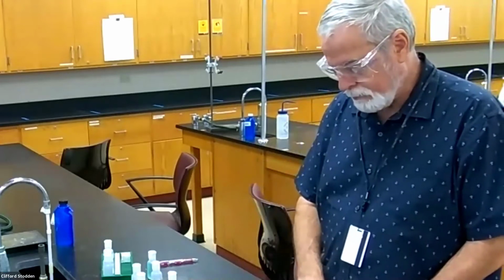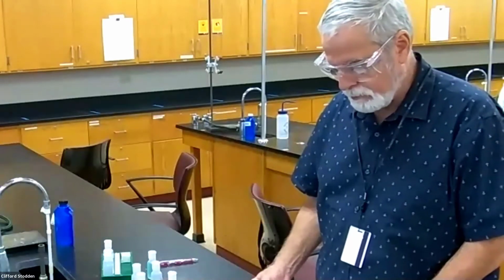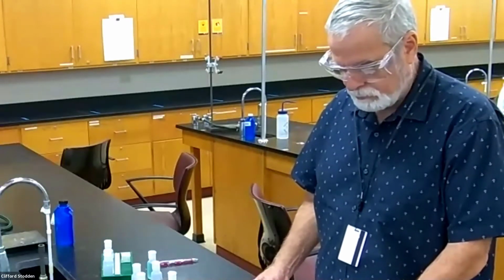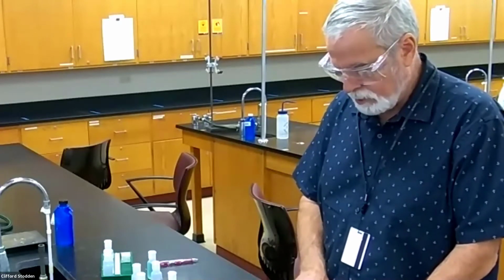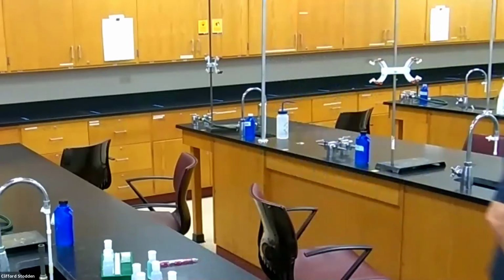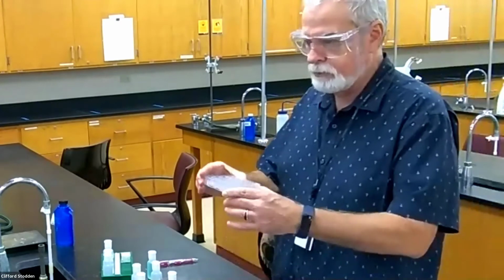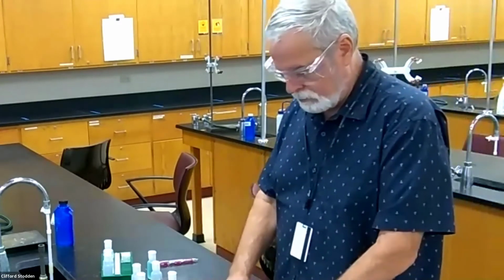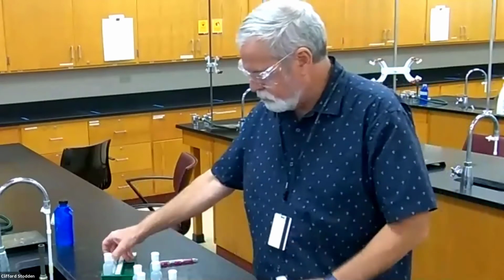For the copper, the first one going across, because we've already done the copper with the calcium, so we don't have to repeat that. So the first one going across would be copper with barium chloride. So we'll see if copper forms a precipitate with chloride ion. So I'm going to do this again with the well plate. I'll just start in the second row here. And just to take some time now, copper is the blue one.